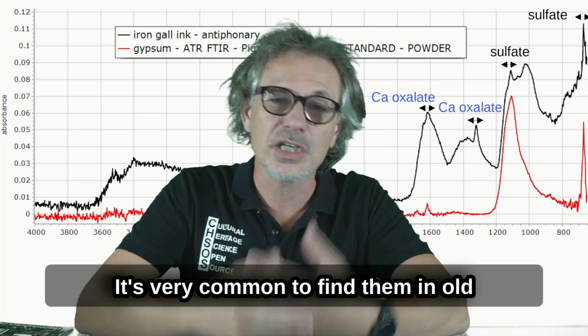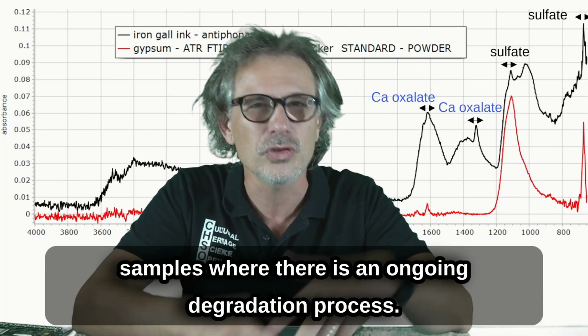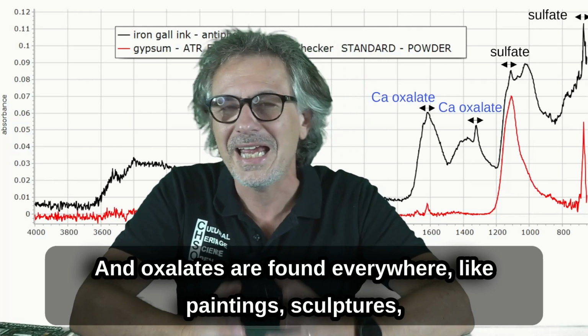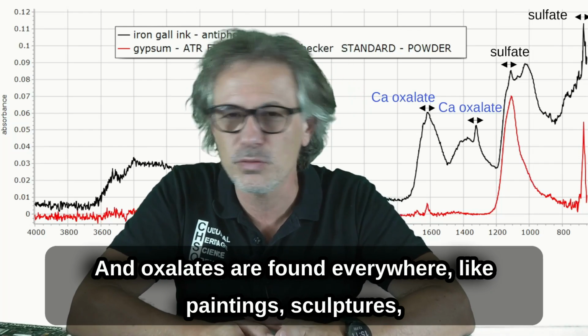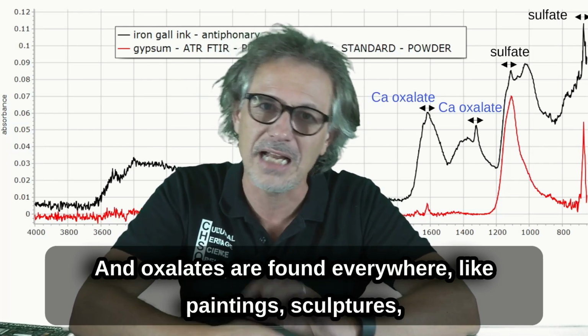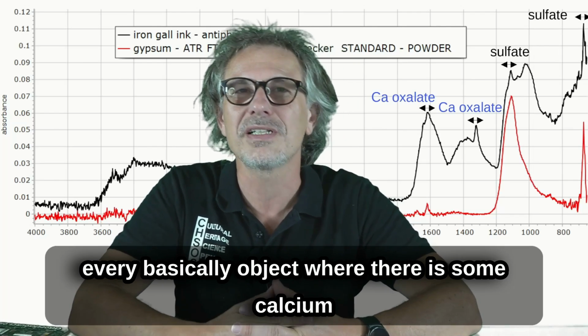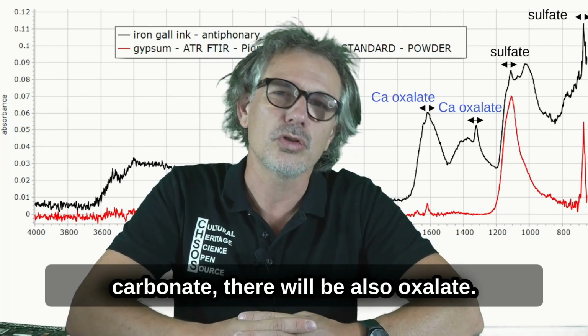It's very common to find them in old samples, where there is an ongoing degradation process, and oxalates are found everywhere, like paintings, sculptures, basically every object where there is some calcium carbonate. There would also be oxalate.